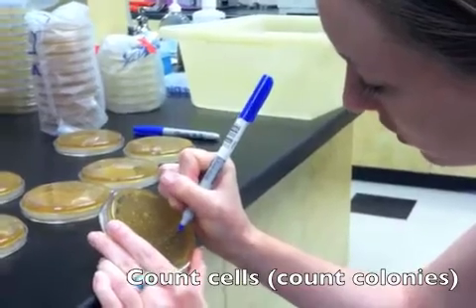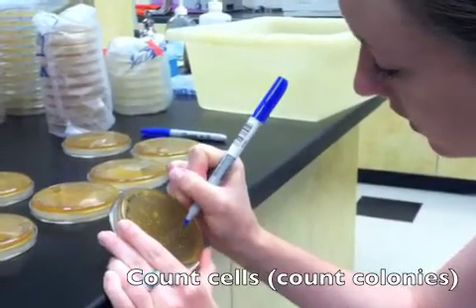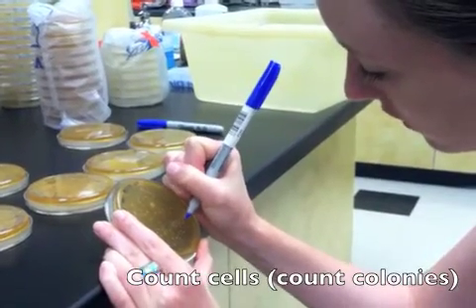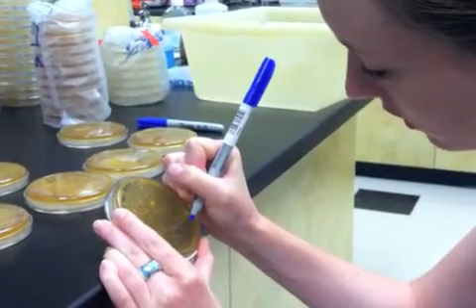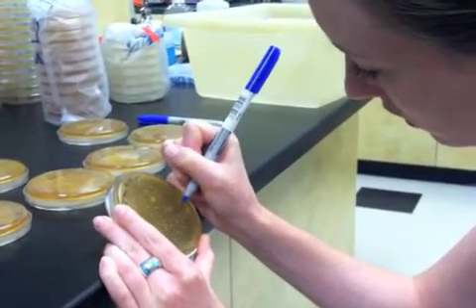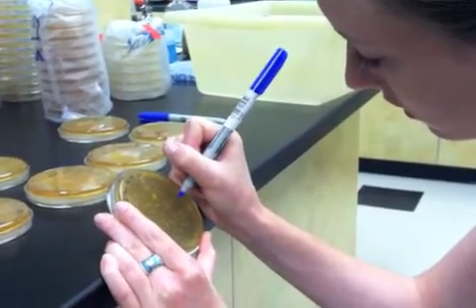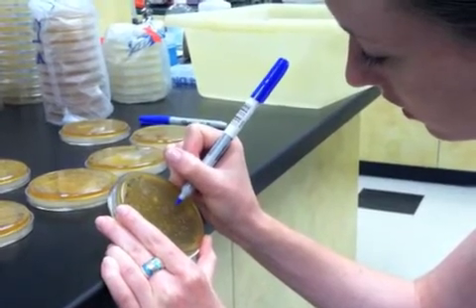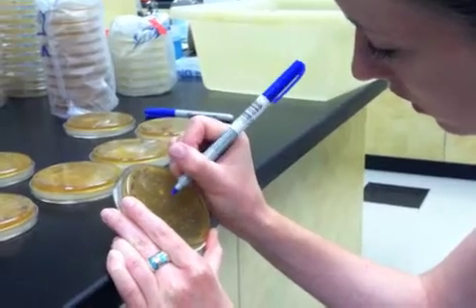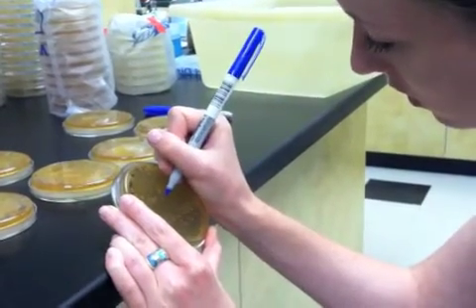Okay, so Tiffany is counting colonies on her plates, and she's using a Sharpie to touch the bottom of the plate at each place where she sees a colony, and that lets her know where she's counted a colony and where she still needs to count. If she loses track of her count, she can just wipe these Sharpie markings off with ethanol and start over.